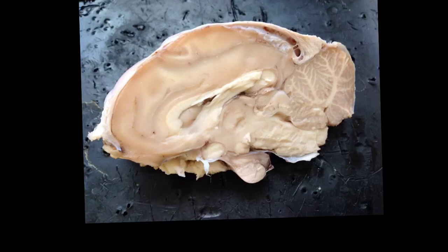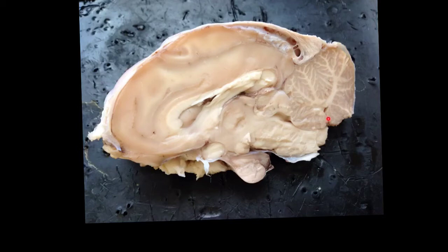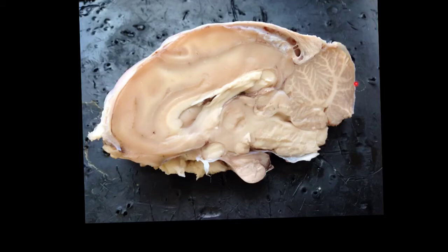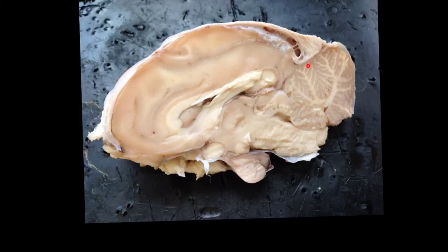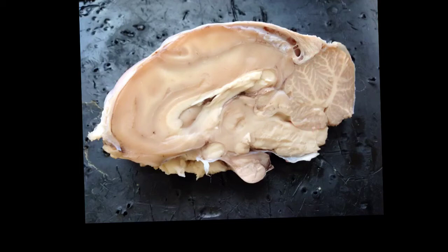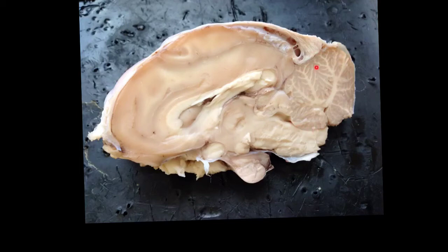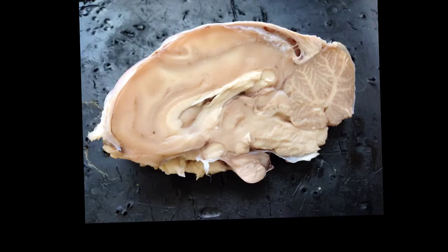The arborvitae is just the white matter, and it is contained within the entire structure called the cerebellum. You can't see it here, but this cerebellum has both a left and right hemisphere as well.